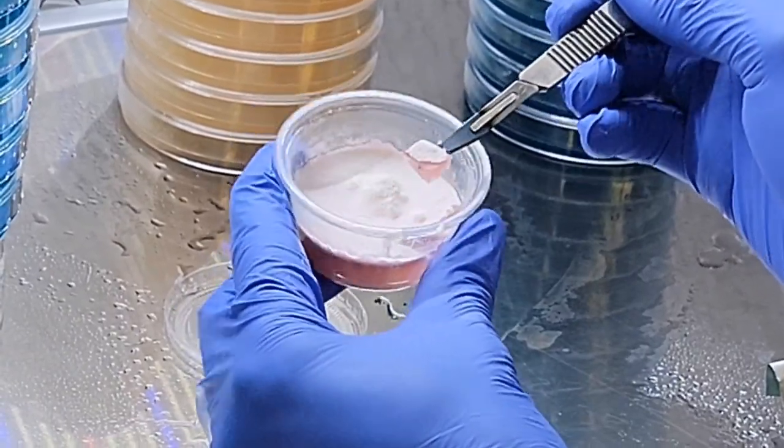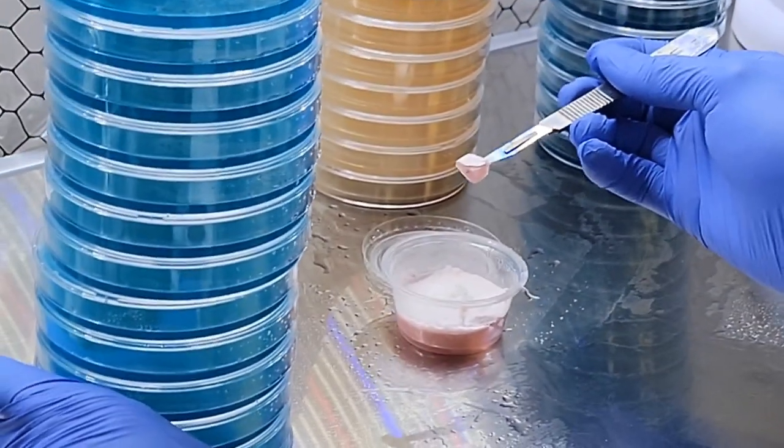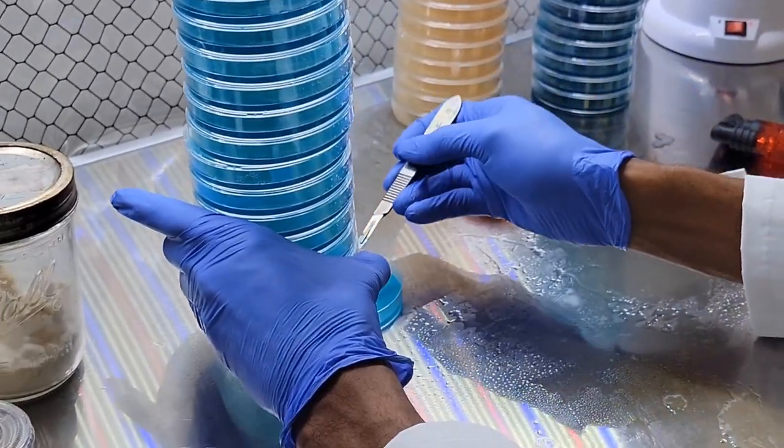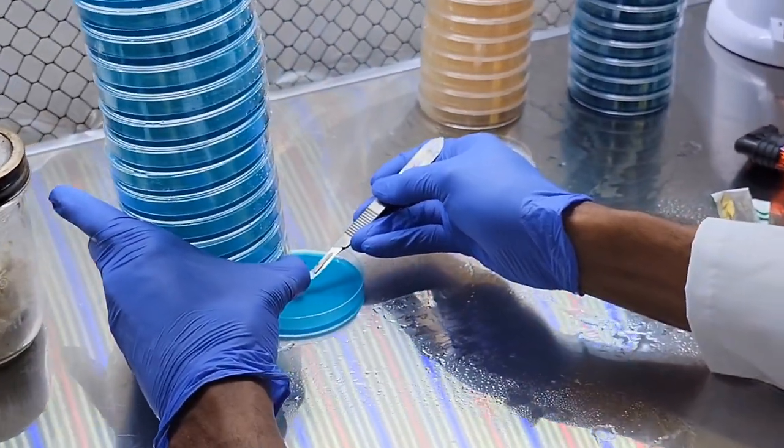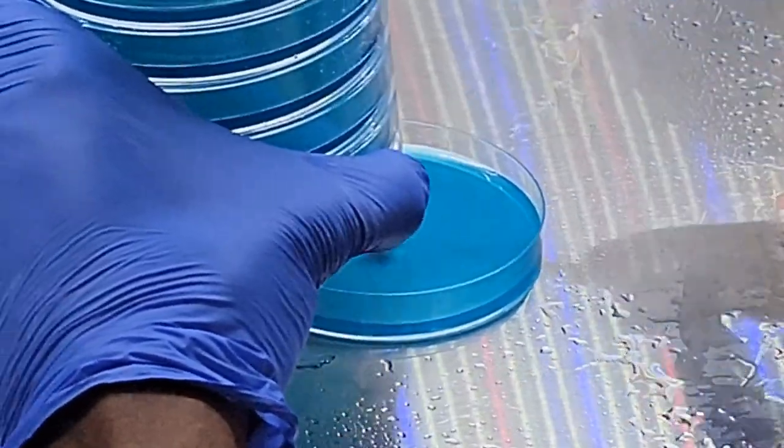So reishi creates like a thick skin, so it can be a little bit difficult to cut through it or really try to hold on. We're just going to take this, place it right on the plate.